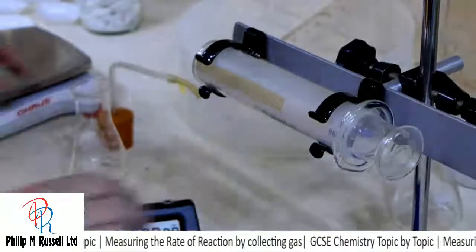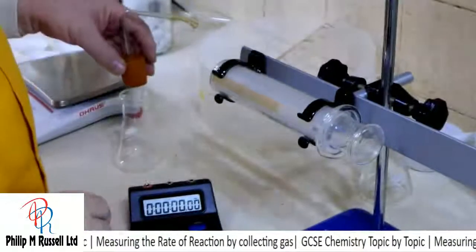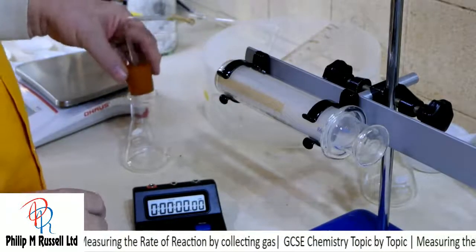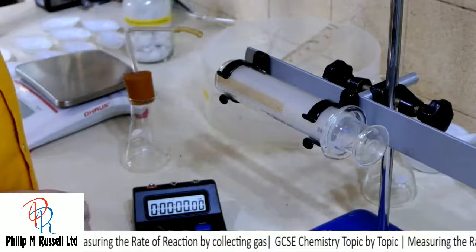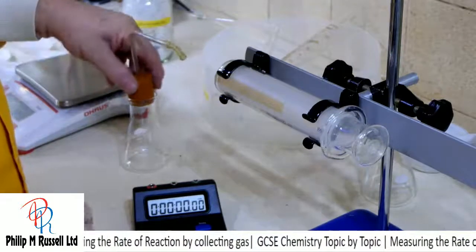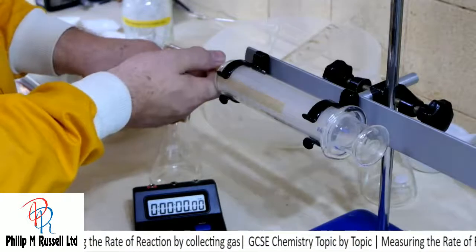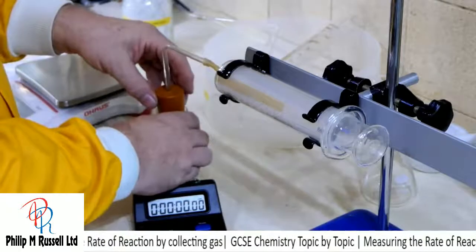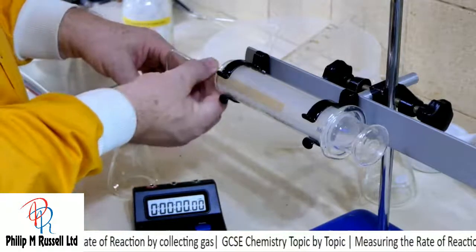I've got a timer, and what we're going to do is take some acid and put it with some calcium carbonate. This is chalk, and I'm going to connect this up here so it makes an airtight seal, and we're ready to go.